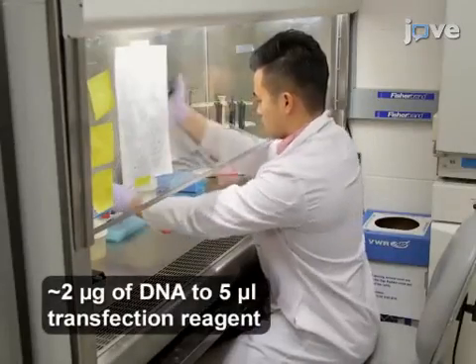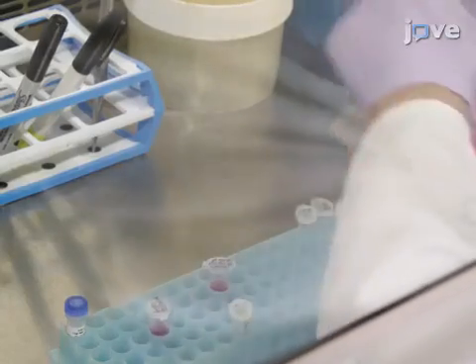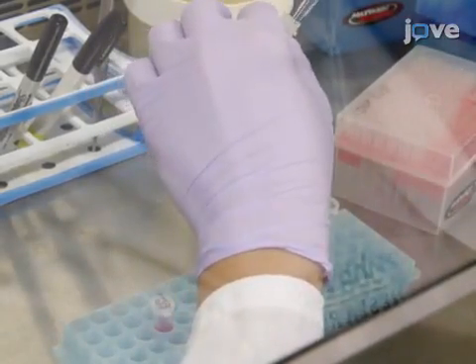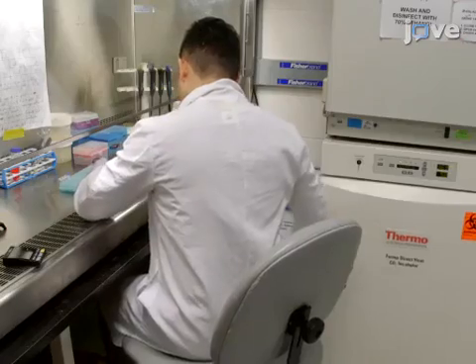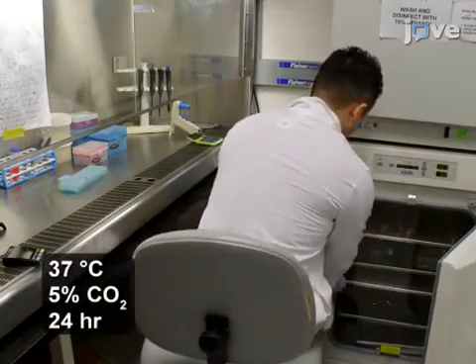After plating SN56 cells and allowing them to proliferate according to the text protocol, in a cell culture hood, use plasmids expressing a fluorescent protein-tagged galactosyltransferase, a fluorescent protein-tagged compartment marker, and a protein of interest tagged with PAGFP to transfect the cells. Incubate the transfected cells at 37 degrees Celsius in a 5% carbon dioxide incubator for 24 hours.